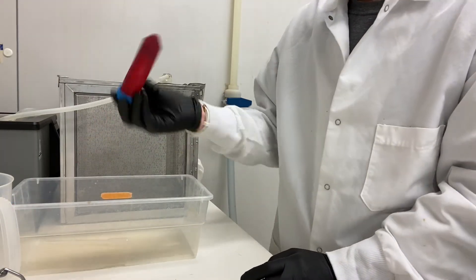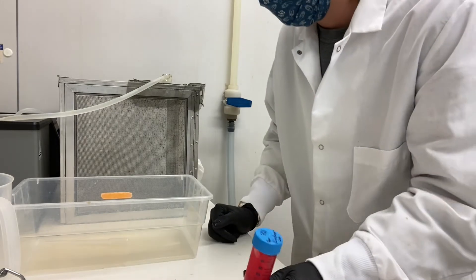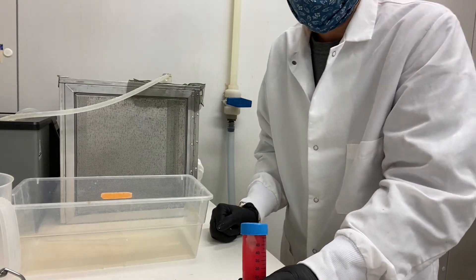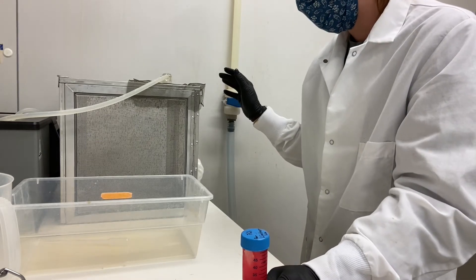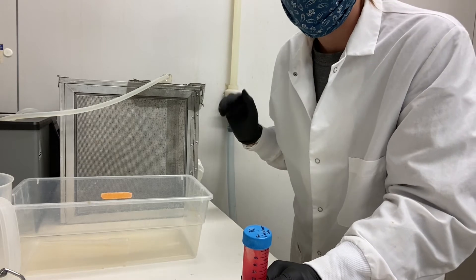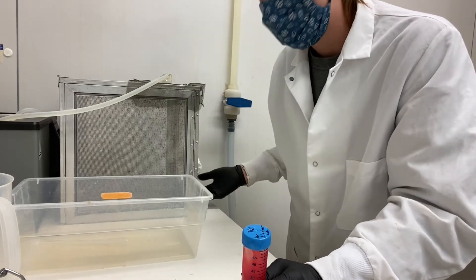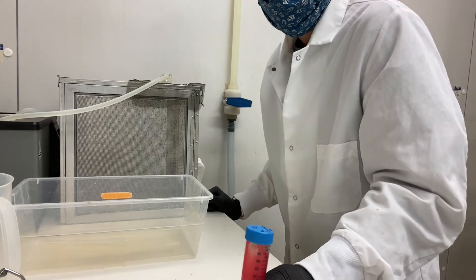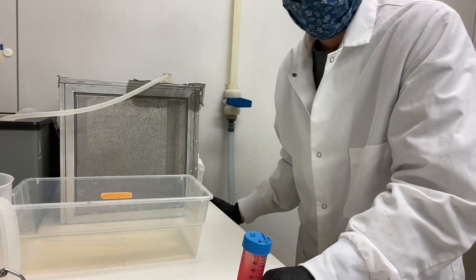I like to put one mil of blood in each crucible first just to make sure the mosquitoes are feeding well so you don't waste any blood. Put one mil each and wait ten minutes. If you see they're feeding well — you can tell by red blood droplets at the bottom of the cage on the paper towel — then add about two mils of blood and let them sit for an hour.